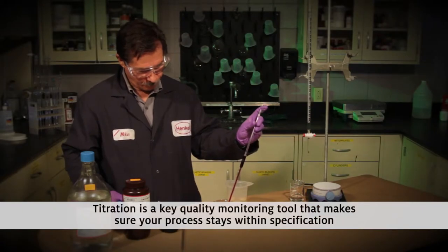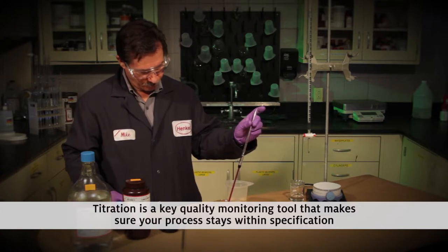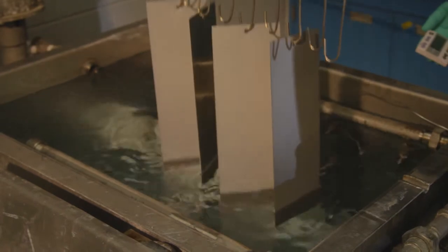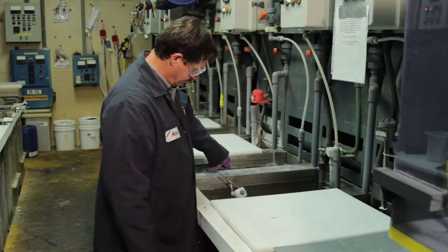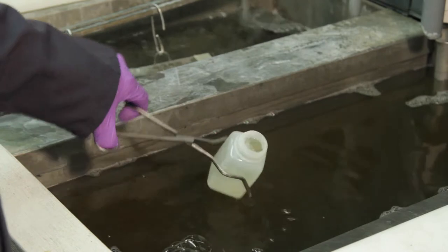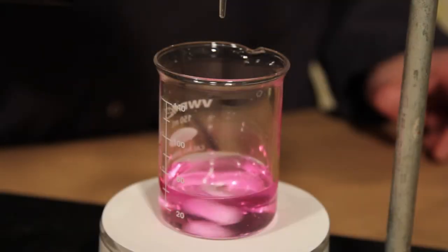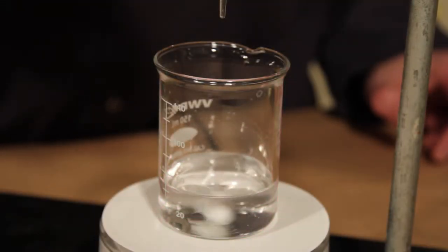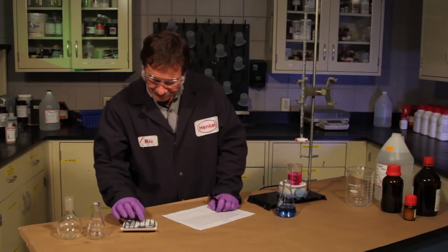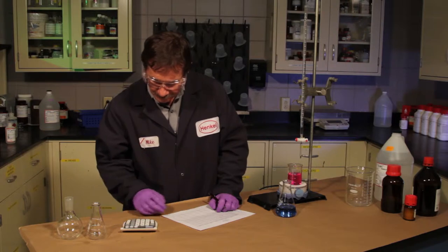Titration is a key quality monitoring tool that makes sure that your process stays within specification and that you continue to produce quality parts. A reverse titration uses a sample of the production bath, which is of unknown strength, to react with a prepared solution of known strength. The amount of bath solution used tells operators the strength of the bath and whether it is within specifications.